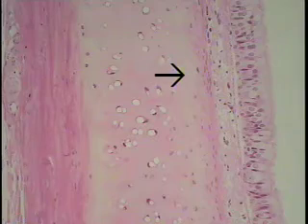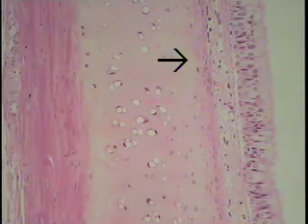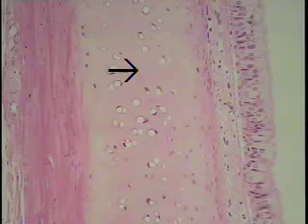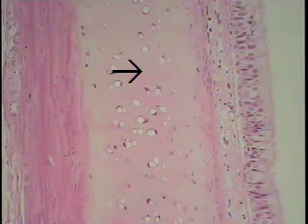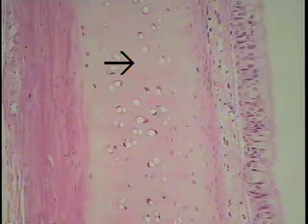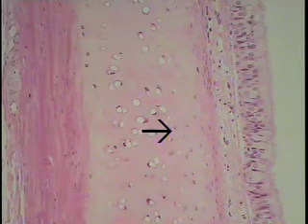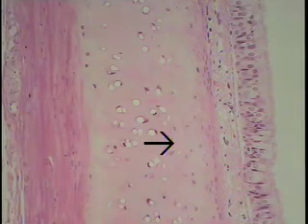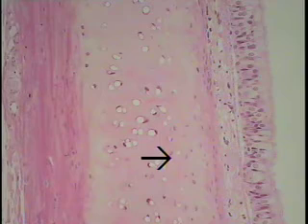Inside the perichondrium we can see the matrix made up of extracellular material — a homogeneous, glassy type of material as indicated by the tip of the arrow — which constitutes the greater majority of this particular tissue. Remember, in connective tissues the extracellular materials are the predominant features. Scattered within this extracellular matrix are small cells, the cells of cartilage, referred to as chondrocytes, illustrated at the tip of the arrow.